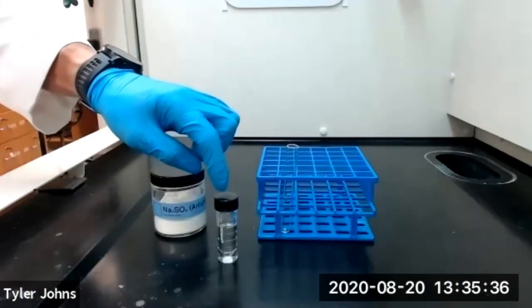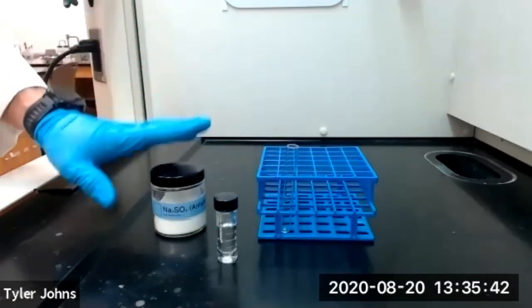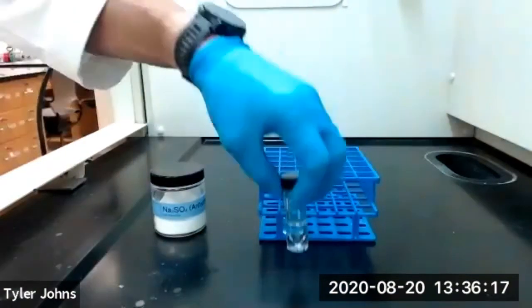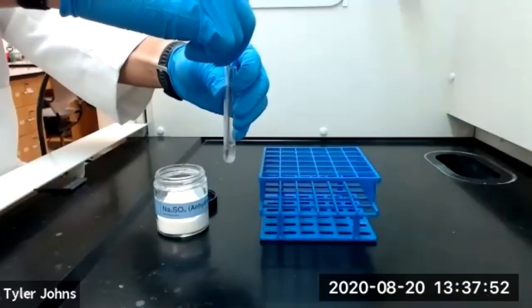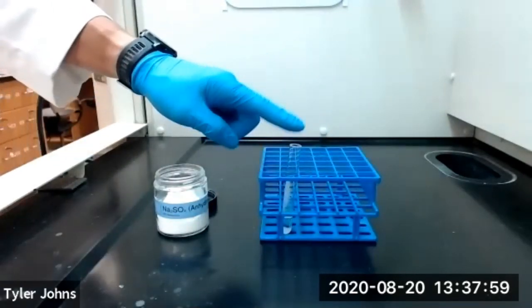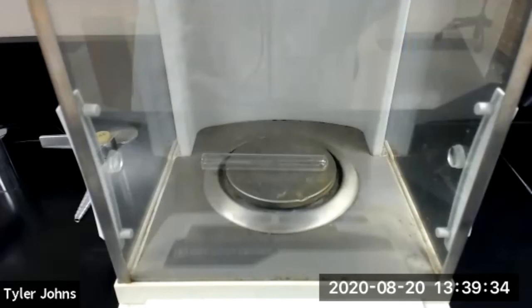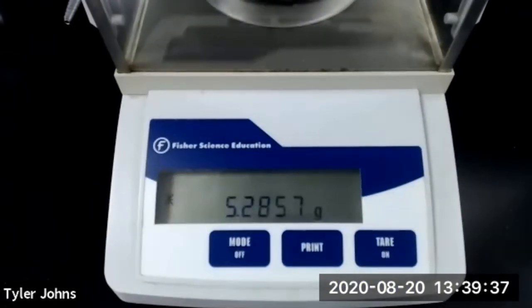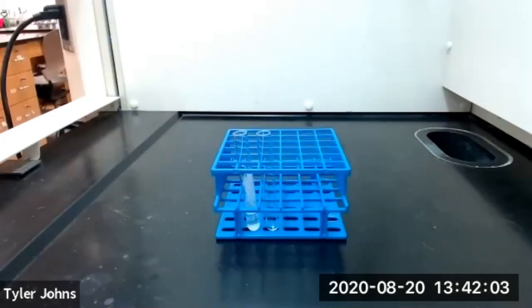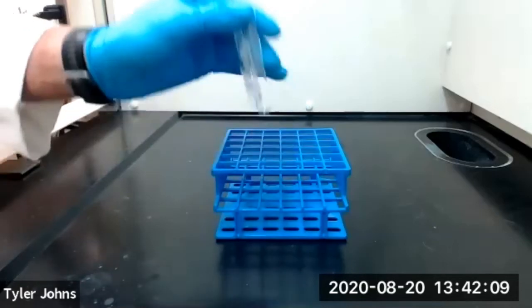We'll now transfer the bottom organic layer of methylene chloride to a clean test tube and dry the organic layer with anhydrous sodium sulfate. While our organic layer dries, we need to pre-weigh a clean test tube. The mass for our pre-weighed test tube is 5.2857 grams. We'll now transfer our dried organic layer of methylene chloride to our pre-weighed test tube using a filter tip pipette.